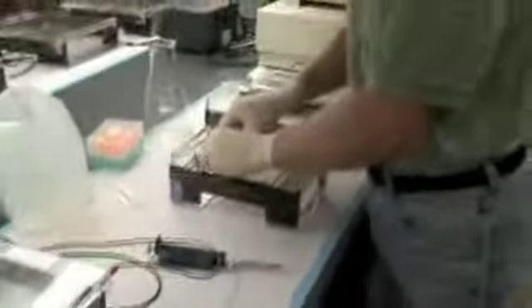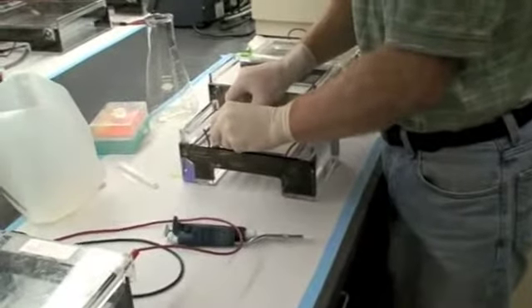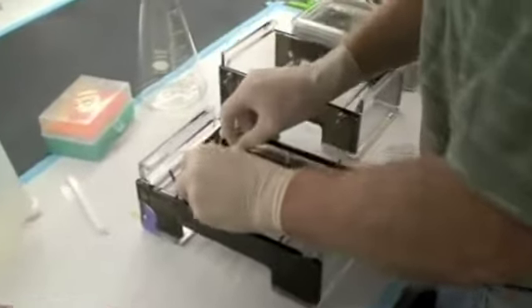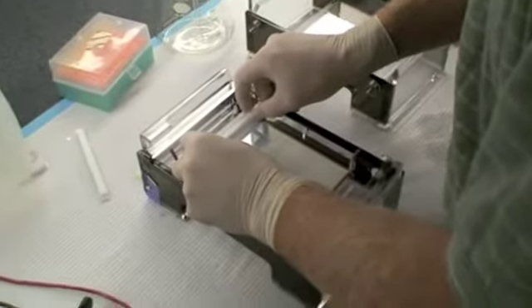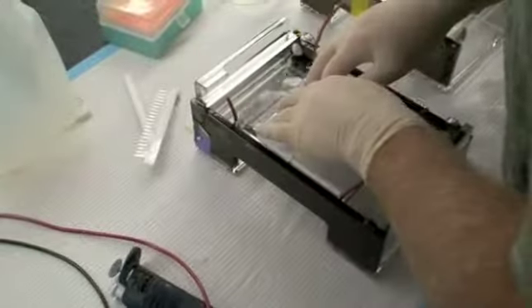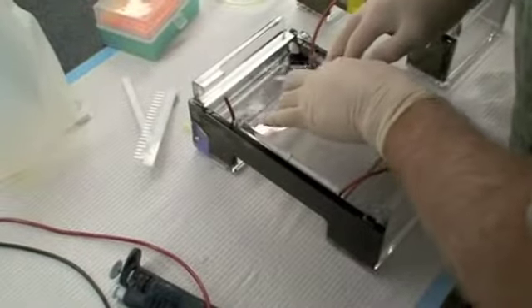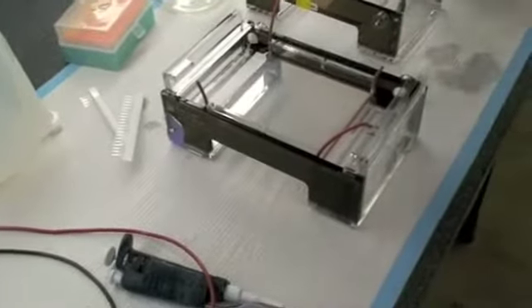So now that the gel is submerged, it's really easy to pull out the comb. I want to pull it out even, so I'm using two hands, one hand on each side of the comb. I'm actually pulling very slowly. I want to pull straight up so I don't lift the gel off the bottom. It came up a little bit. It's important that the gel does run flat.